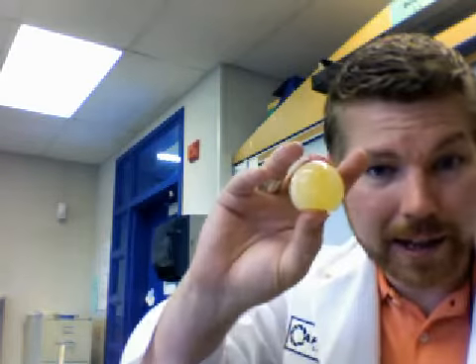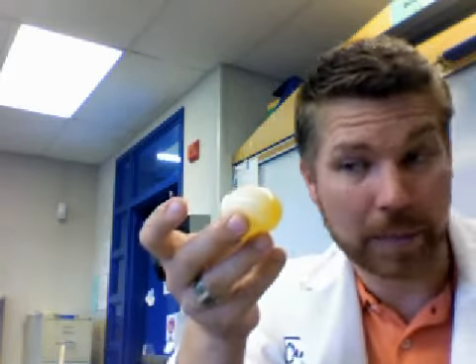The other egg, you may be able to even see too, it lost quite a bit of mass. And this one's actually been sitting in water again a little bit, so it's increased. But the other egg lost about 30, no, I'm sorry, yeah, about 30 grams. 30 grams decrease in mass. So this was the egg that was in the Karo syrup, and it lost 30 grams of mass. The other egg in water, it gained about 2 grams of mass.